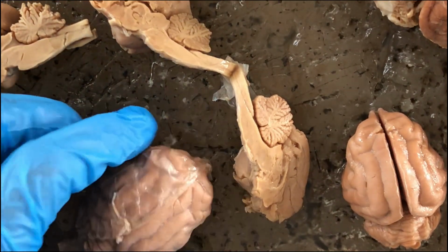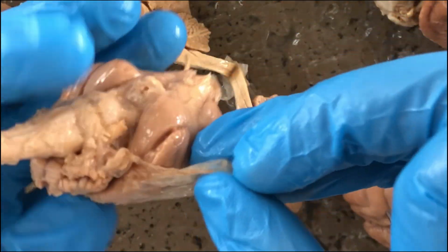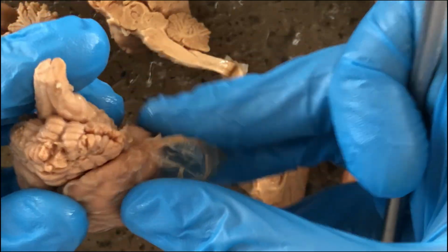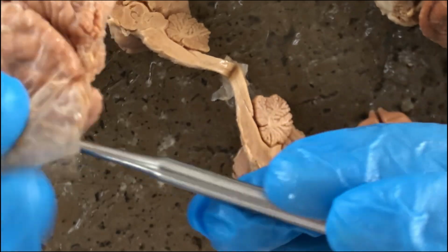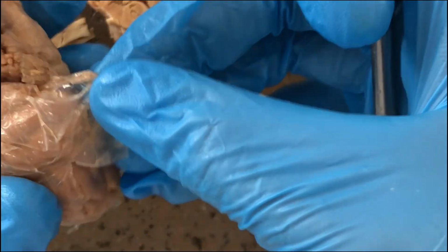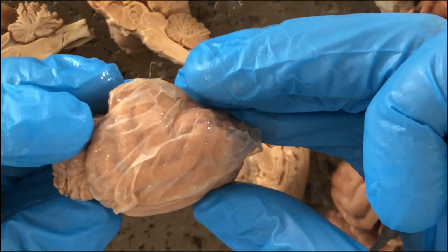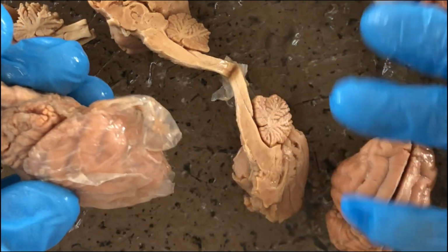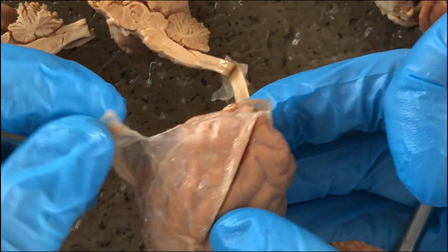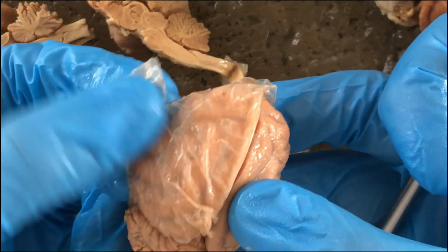So let's start with the dorsal aspect. So first and foremost, you'll see that the brain will be covered by tough connective tissue that in life actually encases a cavity inside filled with fluid. So those connective tissue coverings of the brain would be the meninges. And as you know, the mammalian brain is covered by 3 layers of connective tissues or meninges. The outermost and the toughest one would be the dura mater.